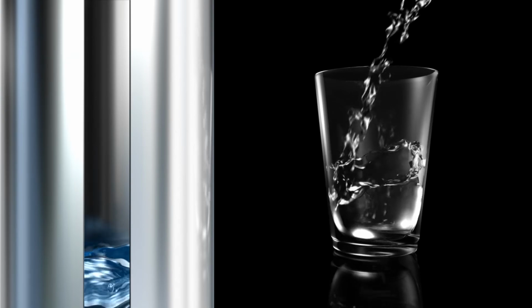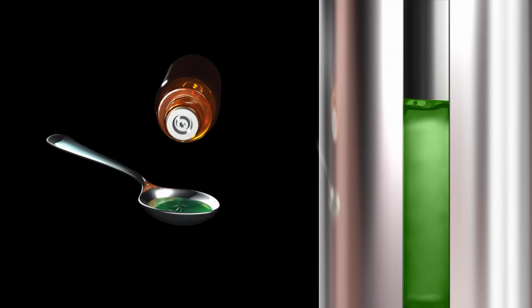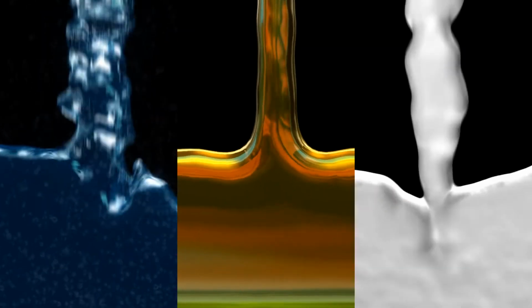Many liquids are essential in our daily life. They may include water, beverages, dairy products, chemicals, acids and bases, or pharmaceutical products. The quality of these liquids is determined by their chemical properties. To assess these properties, various principles of measurement are used.